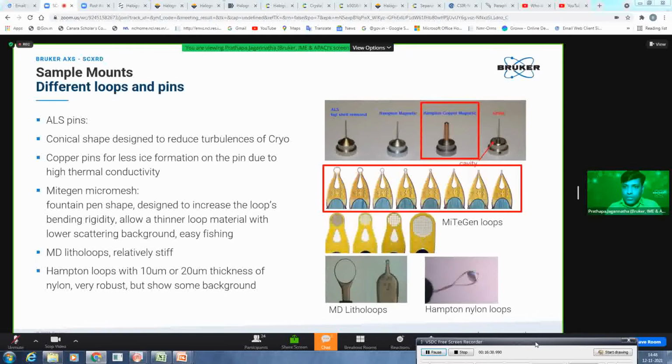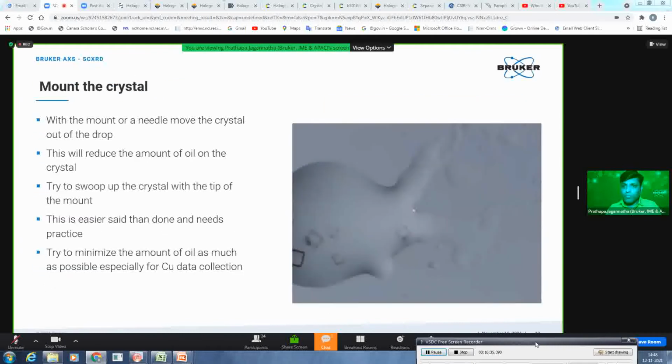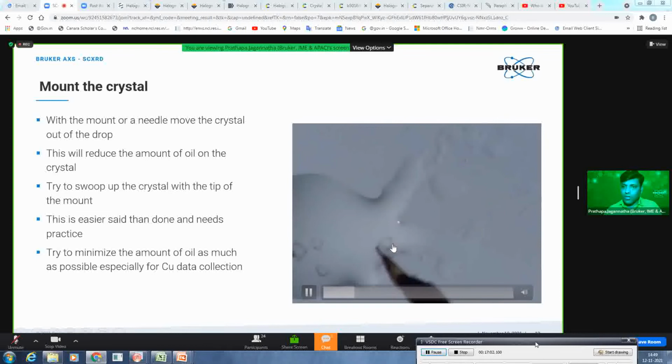Okay, so once he has chosen the micro loops, his crystal is ready. So he has taken the loop now, and the aim is to mount or pick up the crystal onto the loop. You can do it two ways: you can push your crystal outside of this oil using your tool, the acupuncture needle or something, or else you can directly use your loop as well. In this case, my colleague is directly taking the loop and trying to push the crystal outside of the oil.